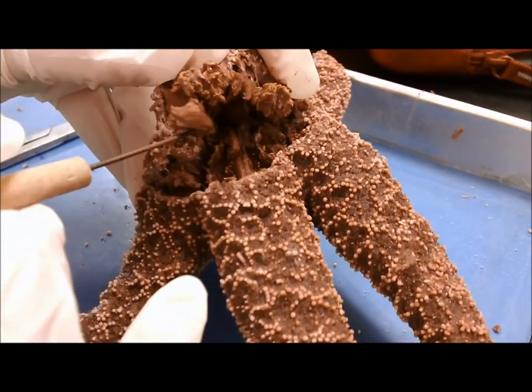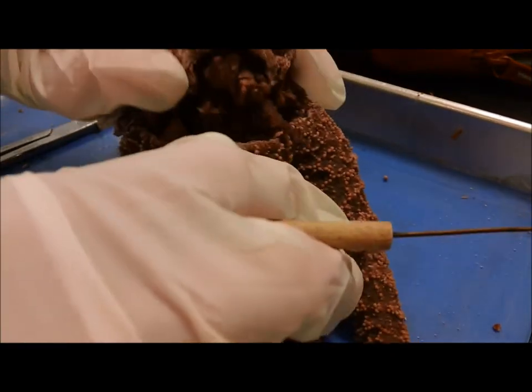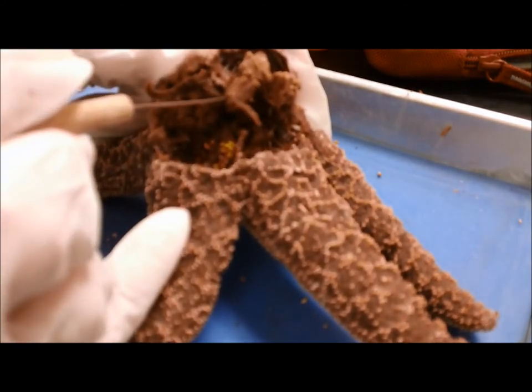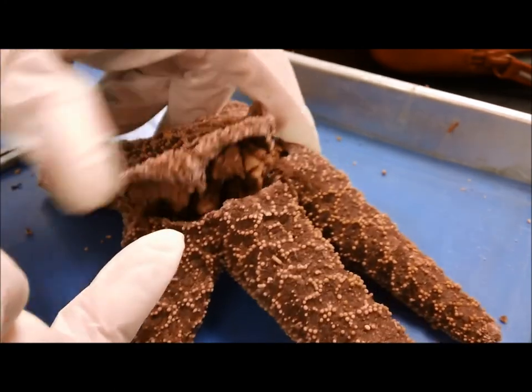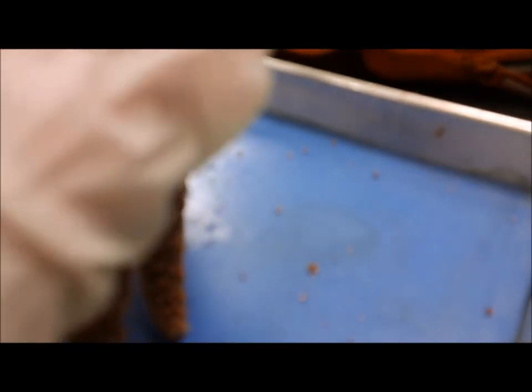Does that mean it was harmed — like mechanical trauma? The fact that these are pulling up like that? No, it just means that the way I cut it, it just happened to come out like that, because I didn't damage it that much when cutting.